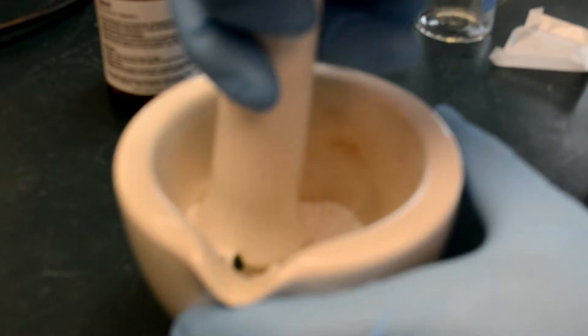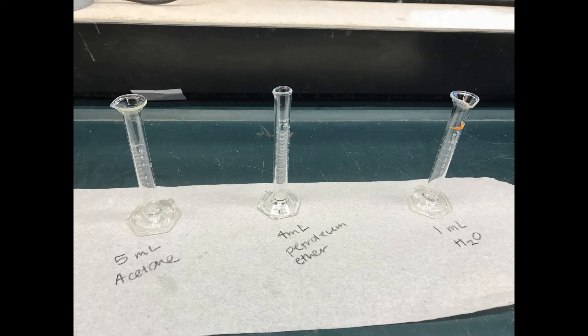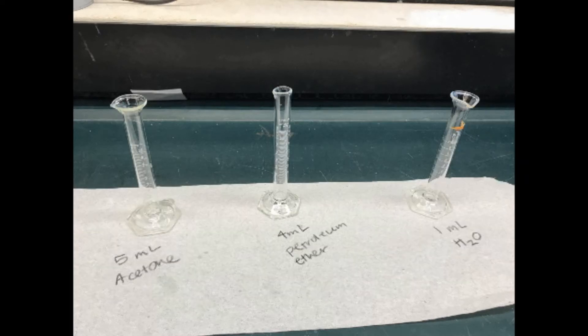Make sure to wear gloves and work inside the fume hood. You will also need 5 milliliters of acetone, 4 milliliters of petroleum ether, and 1 milliliter of water.